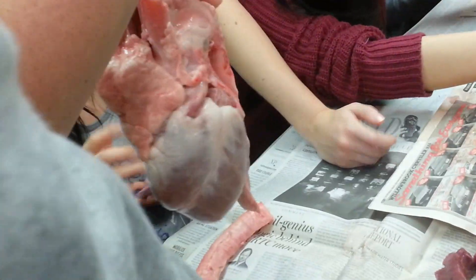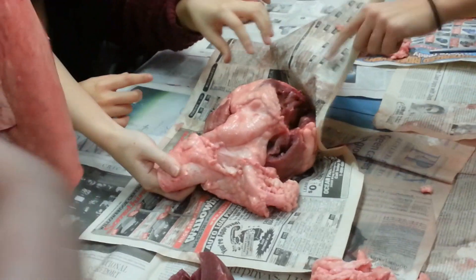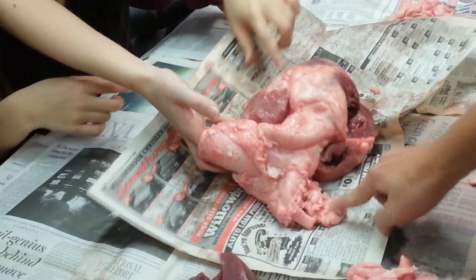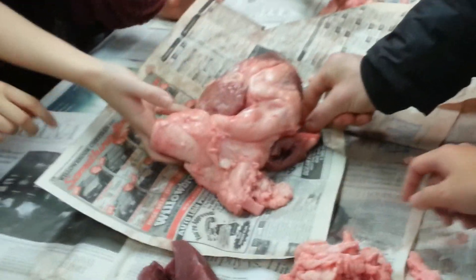Let's find the hole. Oh God, this is so weird. Whoa, is this fat? It's hard. Which part? This. Oh, this is so strange. Ew, why is the fat like that? Did you touch this? No, I think it's fat. The fat would suck. Oh, it is tough.